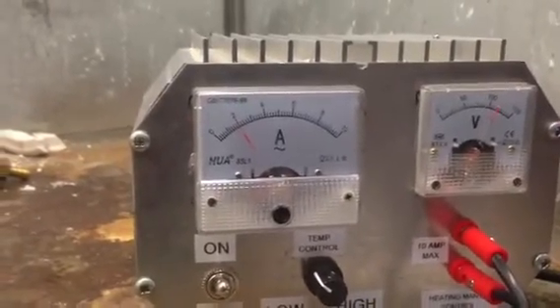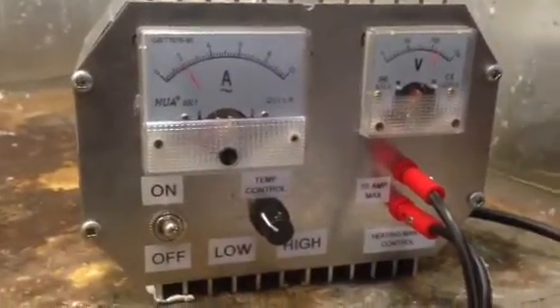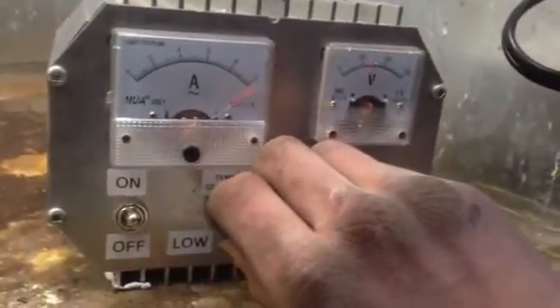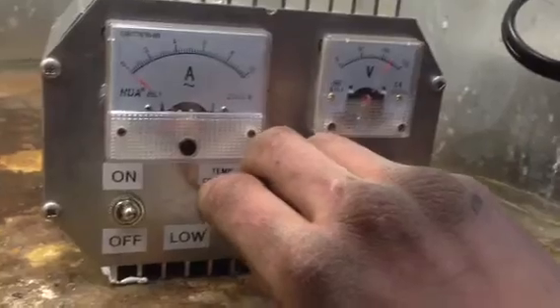It'll boil water at 1 amp easily. This is pushing it for speed. But 10 amps is more than enough. You don't need more than that I can guarantee it.